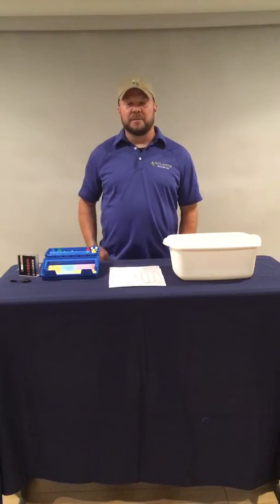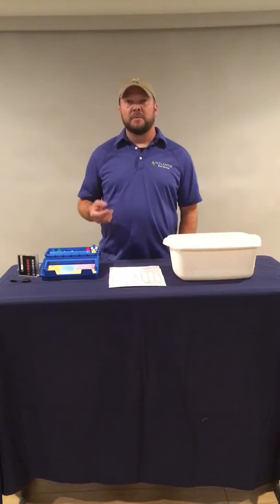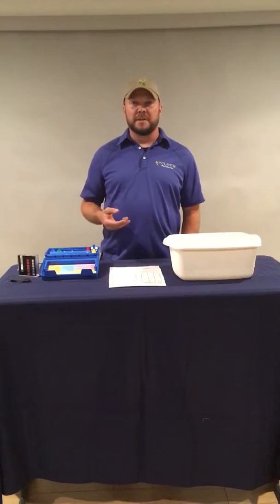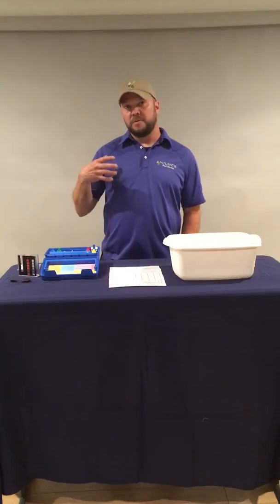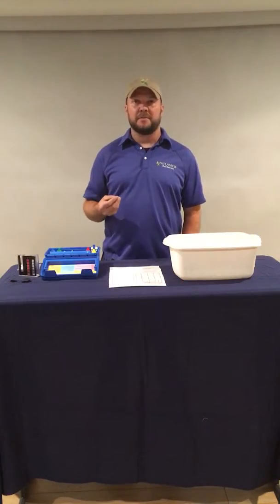All right, now we're going to start with our testing procedure. The first test that we're going to talk about is for chlorine. When we talk about chlorine, there's some important things to understand. When you hear the term chlorine, there's three different types of chlorine that you commonly hear referred to.